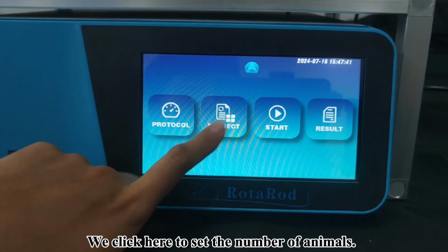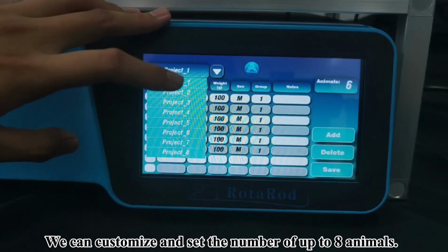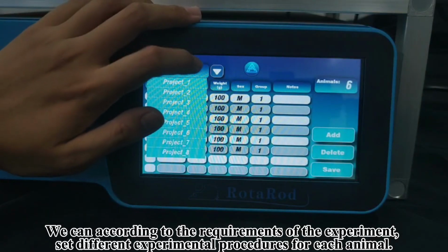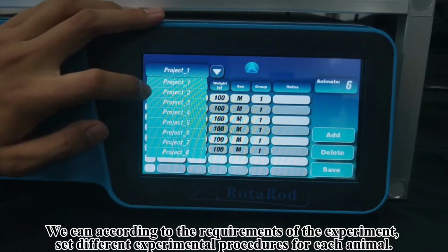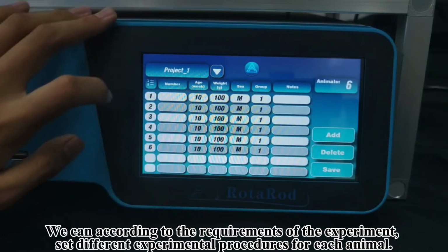We click here to set the number of animals. We can customize and set the number of up to 8 animals. We can, according to the requirements of the experiment, set different experimental procedures for each animal.